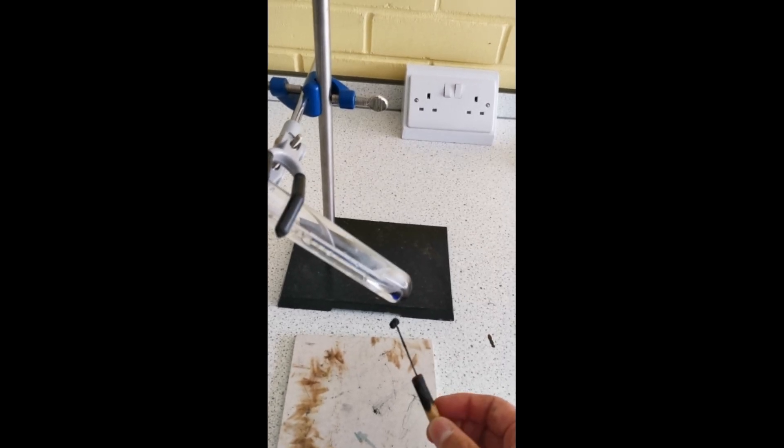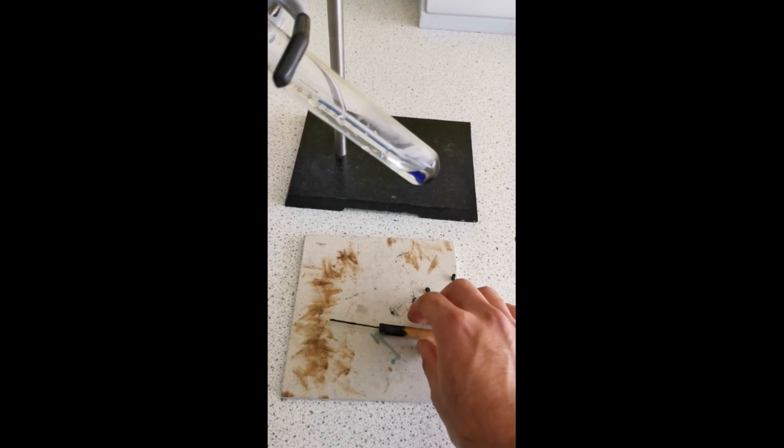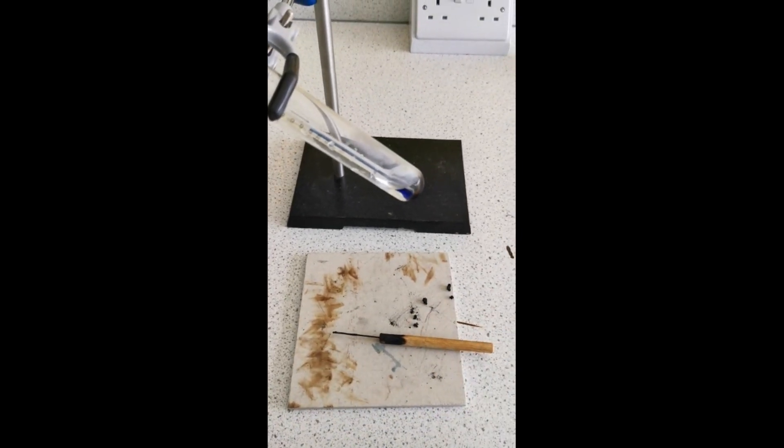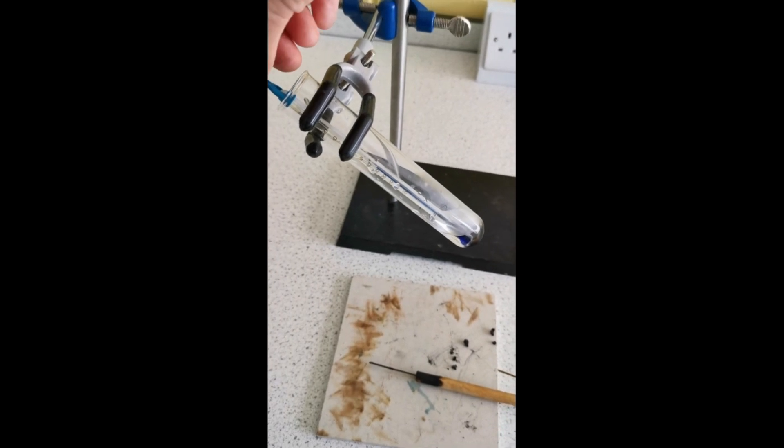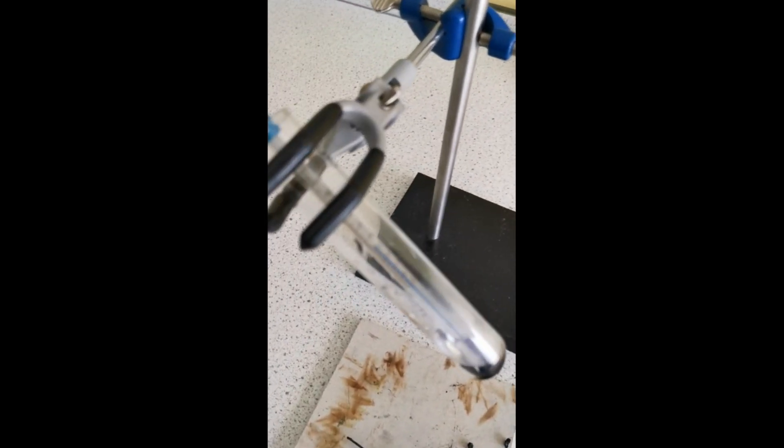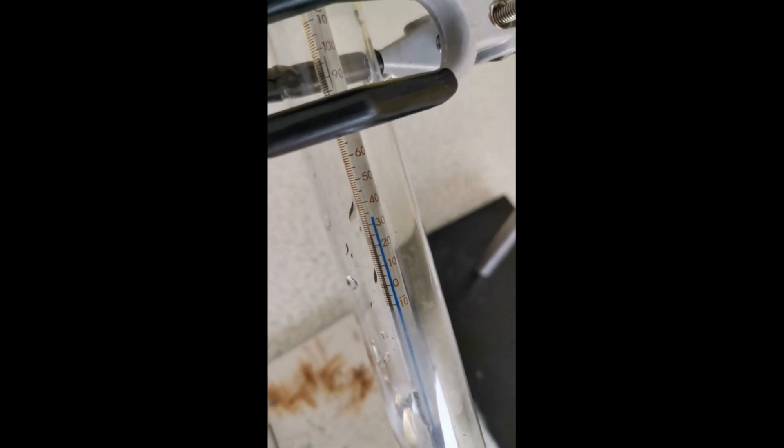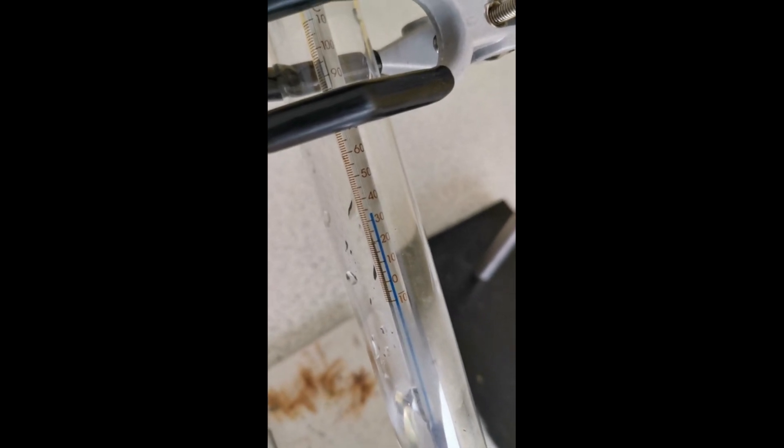That's completely burnt out now. You can wait for the food and the mounting needle to cool down and record the temperature of the water, the new temperature of the water now that it's been heated. As you can see, the new temperature of the water is 33 degrees Celsius.